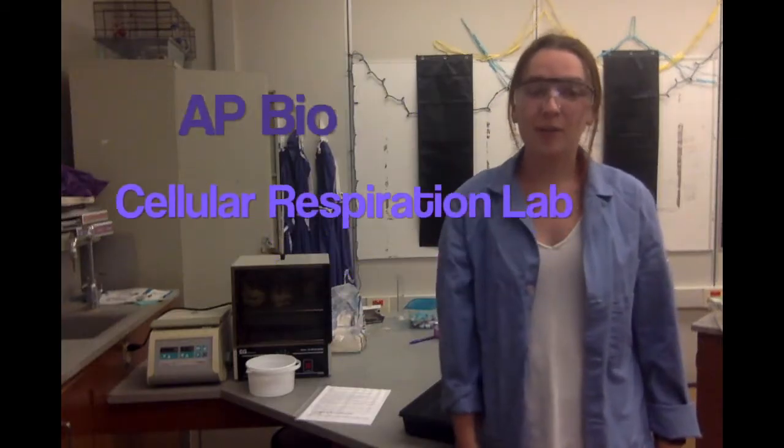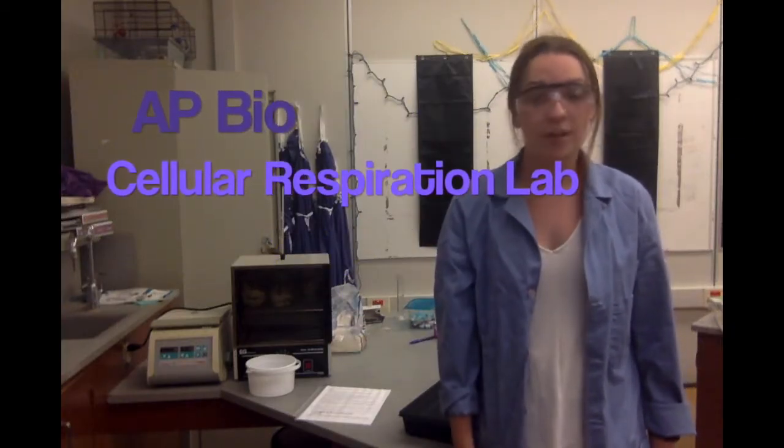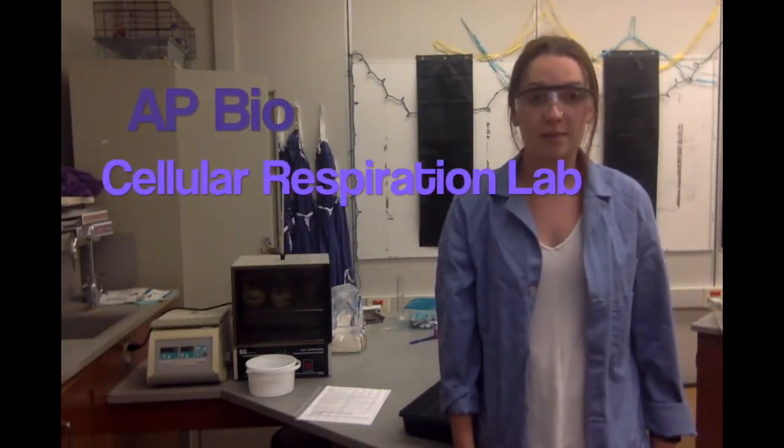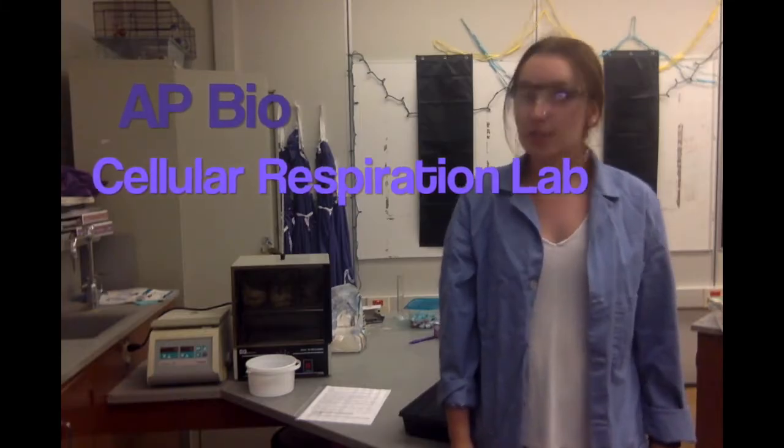Hi APBio, welcome. We are going to be doing the Cellular Respiration Lab for AP Biology today. The question we're going to be testing is: does the type of seed affect the rate of cellular respiration?